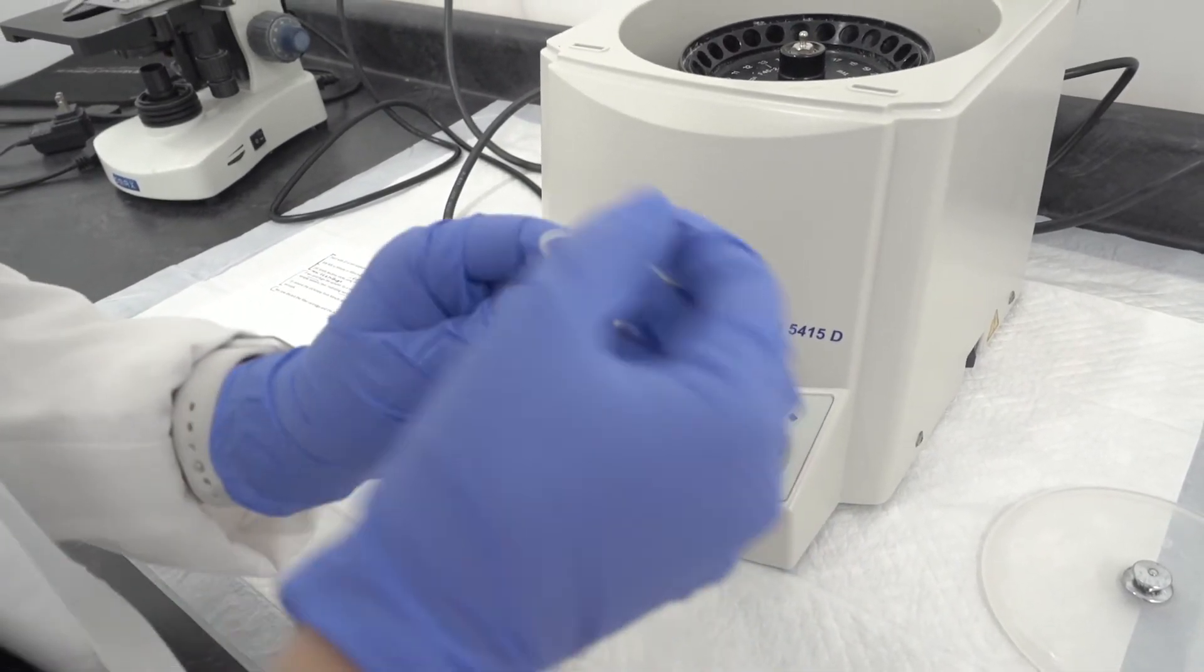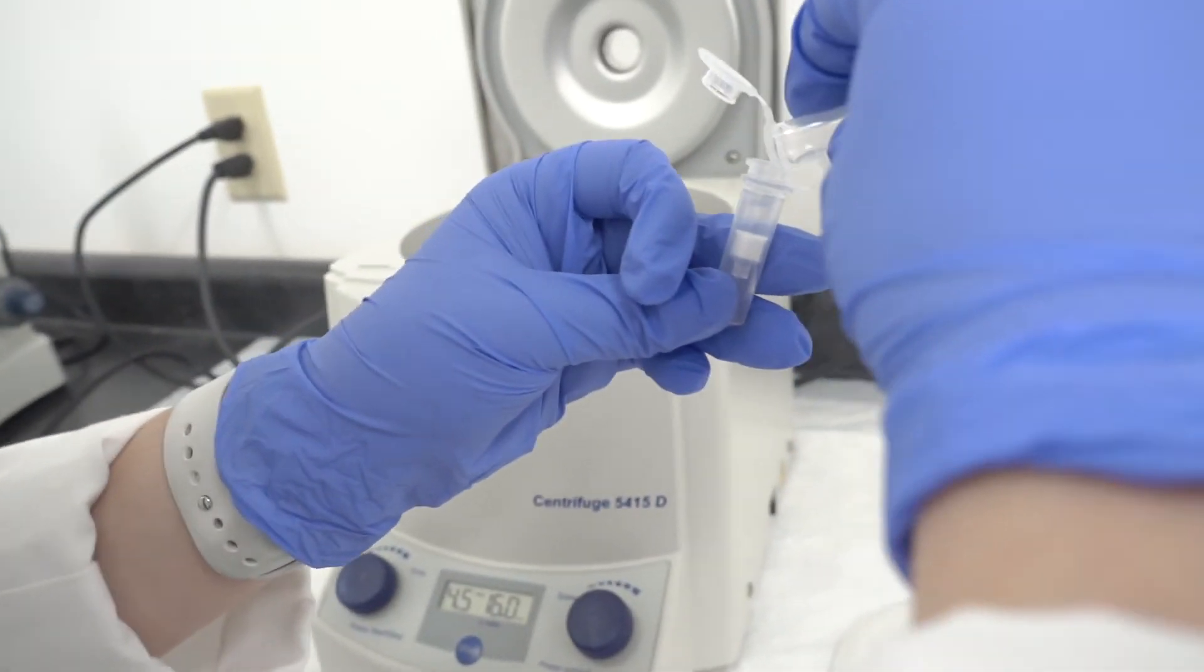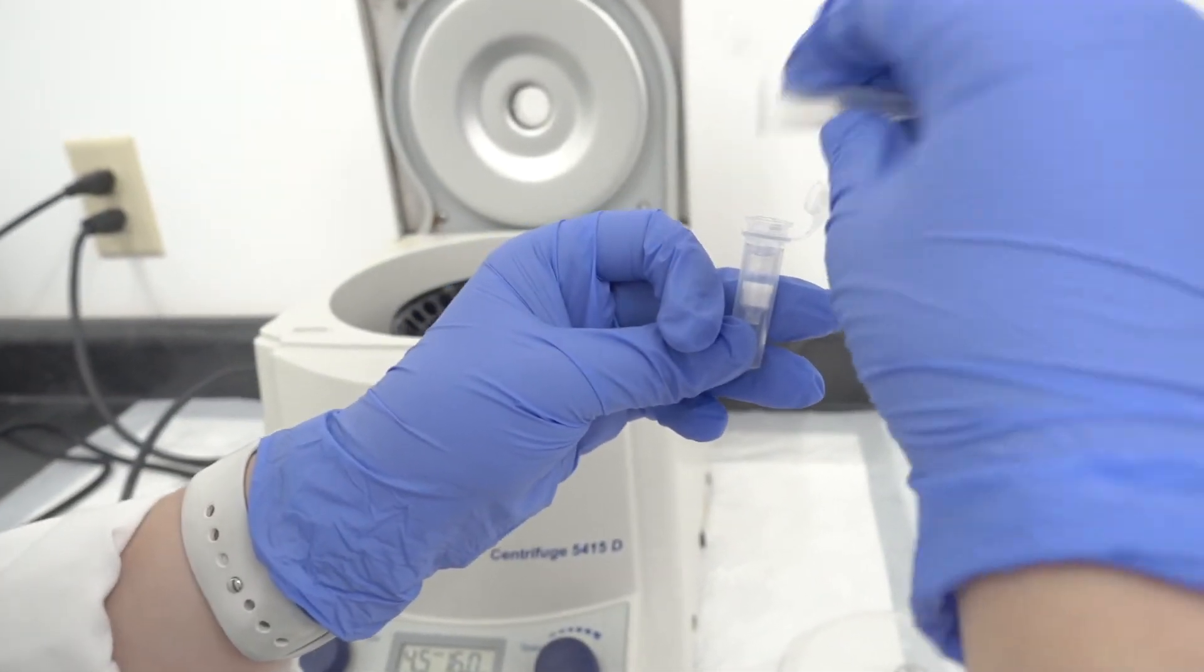It's still sticky, so we put that through the MINUTE filter, pour it in there, and then we filter it out to remove the stickiness.